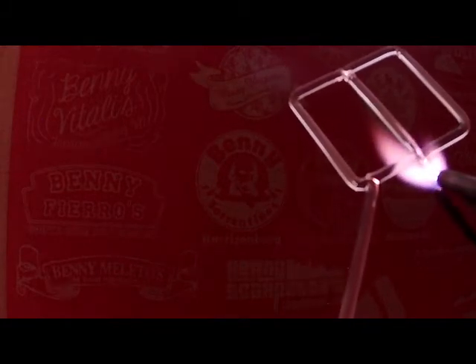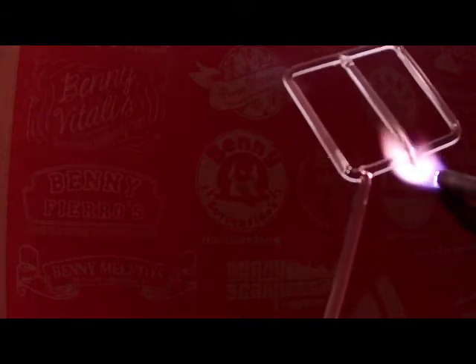And you can see I've taken the rod and I've moved it down the side as I'm making this seal. Pull some of this glass off. I got a little bit more of a tail of glass than I wanted to, so I'm going to heat this blob up and pull it off. I could actually work that into the seal, but it's fine.